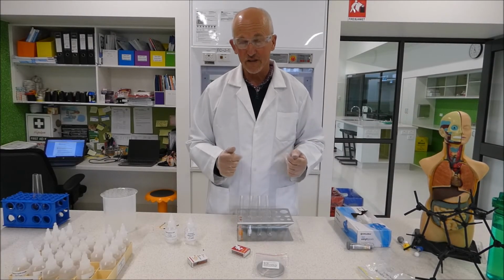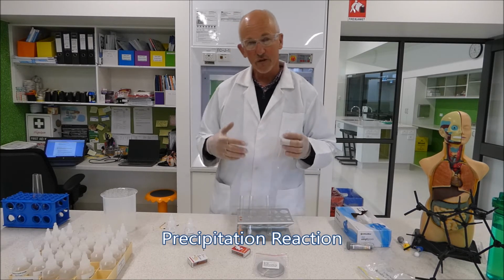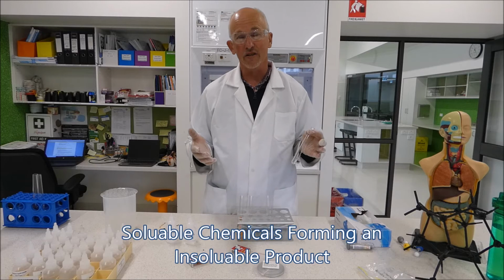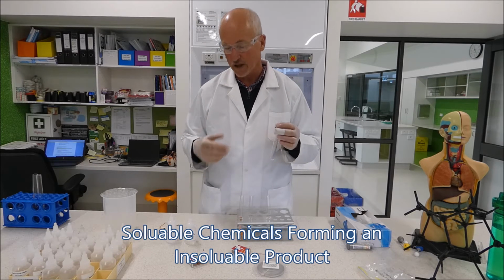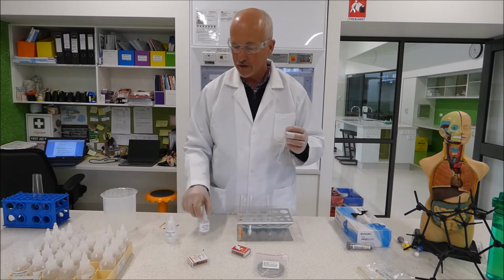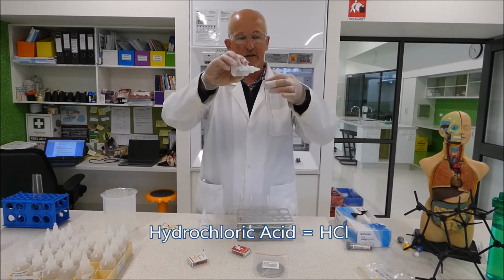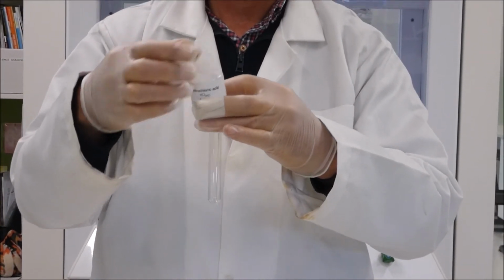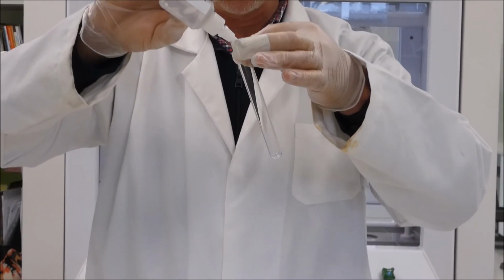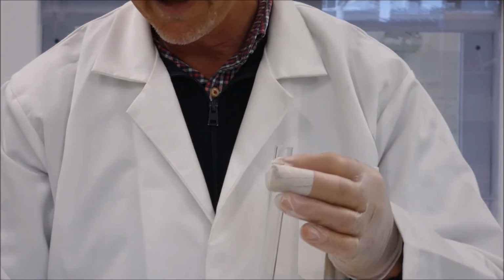Okay, our third reaction for today is going to be a precipitation reaction. And we talked about precipitation reactions in the introduction in that they take two liquids which form a solid which doesn't dissolve in the liquid anymore. So we're going to use hydrochloric acid. We're going to put some hydrochloric acid into the test tube first. We've got a nice bit of hydrochloric acid in there.